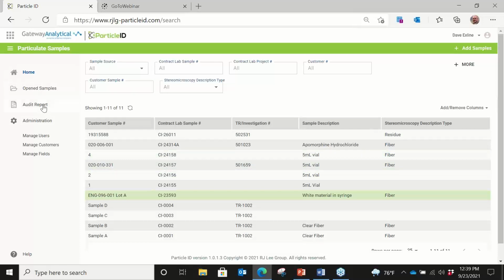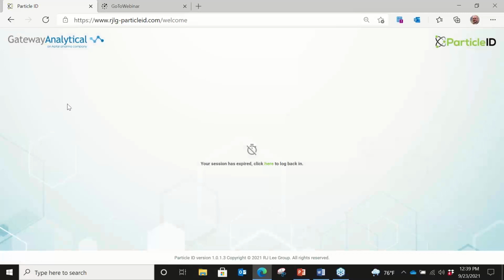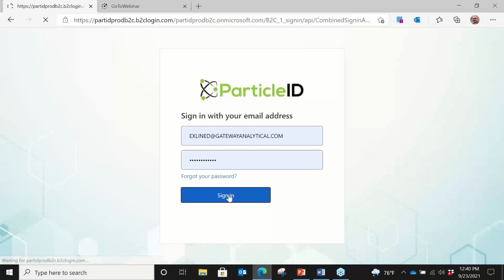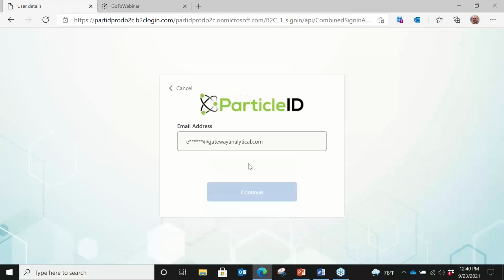And then we can also, as I mentioned before, have an audit report. So anytime anything is changed with anything related to a sample, we would have something along those lines. And then sometimes you get to this point, which is probably a good example, that from a security standpoint, sometimes we have double verification on this, so we have to log into the system.